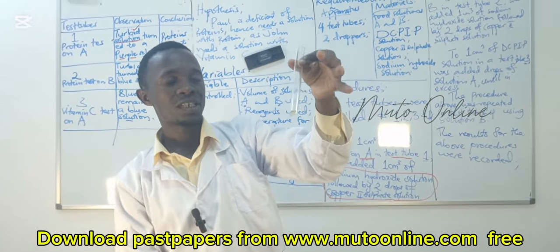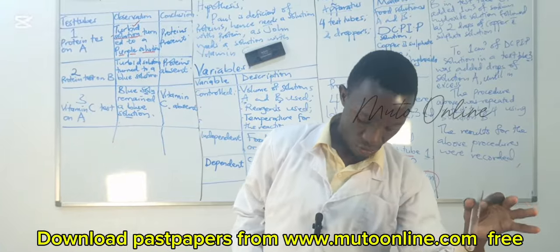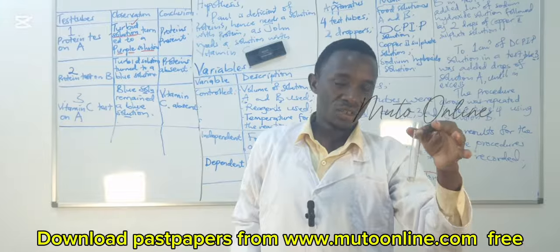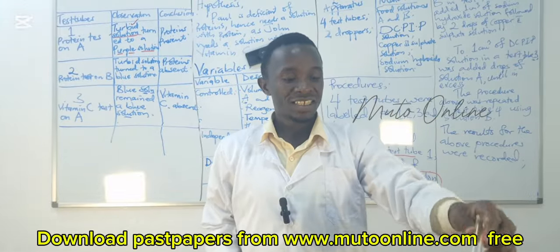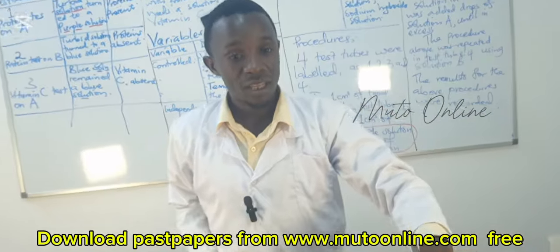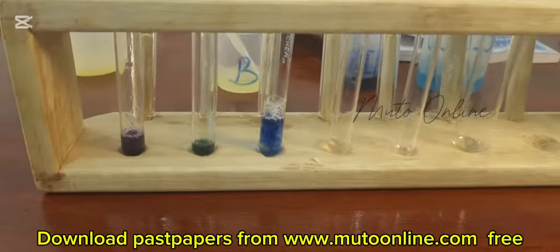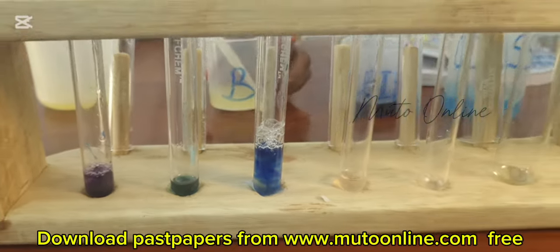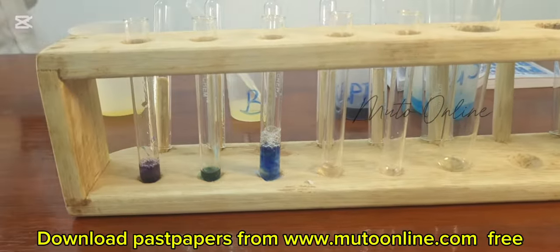Where the blue color of the DCPIP changes to colorless, it is an indication that vitamin C is present in that solution.